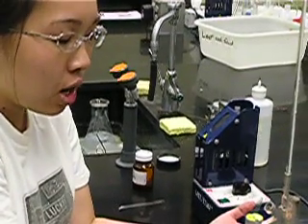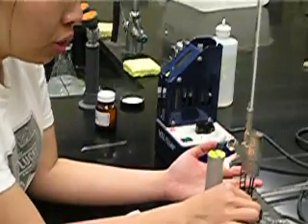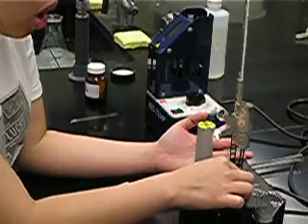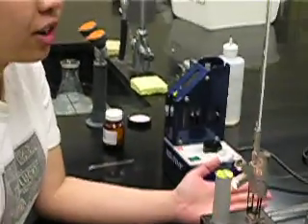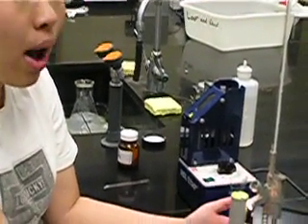So for your second run, you can just adjust the dial to about number 4 when you're about 20 or 30 degrees away from your previous melted temperature.